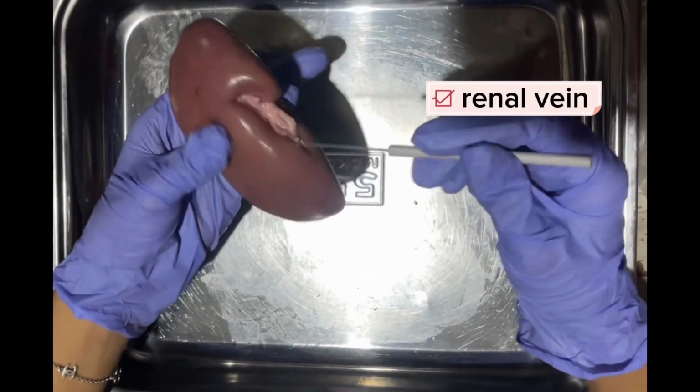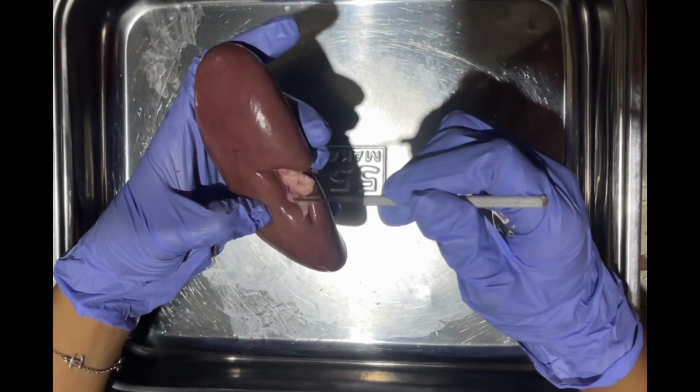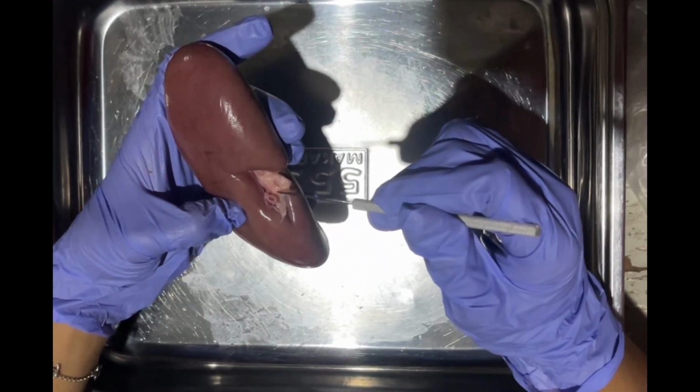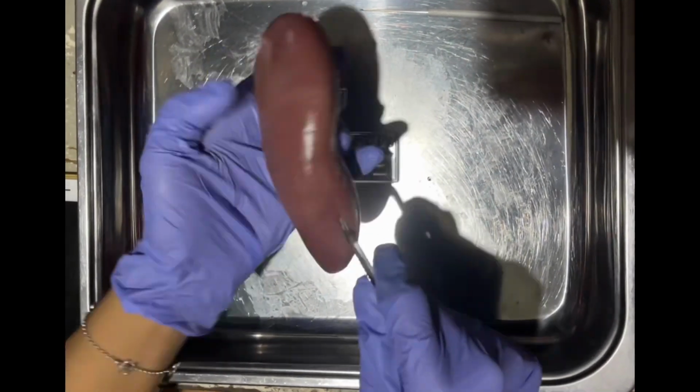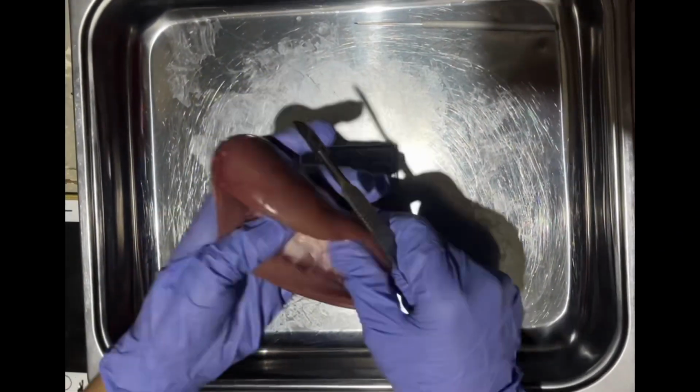It is the main blood vessel that carries blood from the kidney and ureter to the inferior vena cava, a large vein that carries blood to the heart from the lower part of the body. Now, we're going to cut the kidney in half so that we can see the inside structures of the kidney.